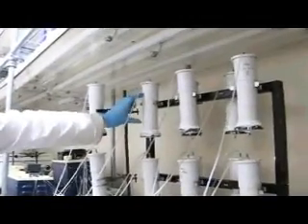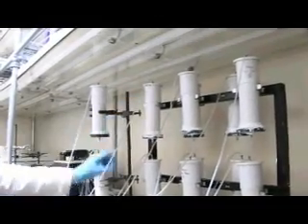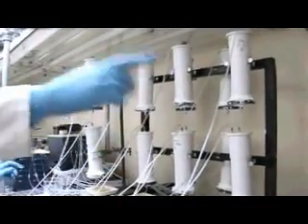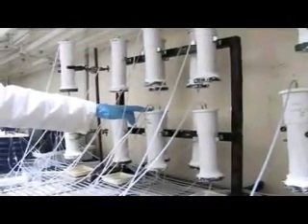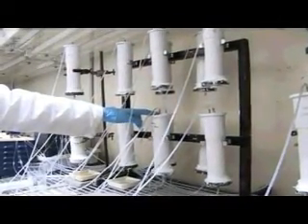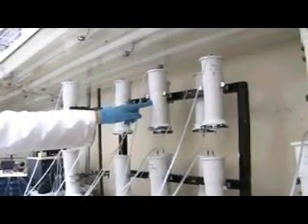So I guess I feel for, if there's a high flow rate with this thickness, how well it will cope with the chemical increase in comparison to this. And then we have scenario three, which is a little bit different — these are the spike columns. This is where I actually start with the flow rate equivalent to the low flow, and when I increase the concentration — so I put the spike through again — I also increase the flow rate to the high flow scenario.